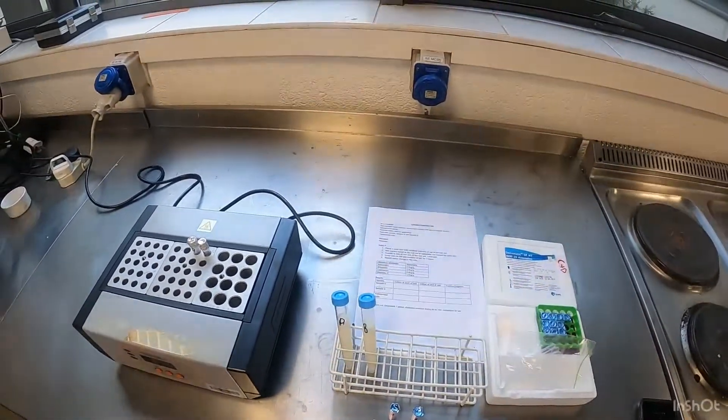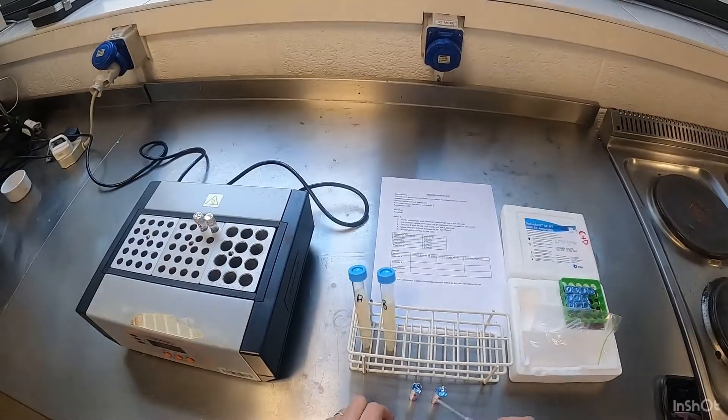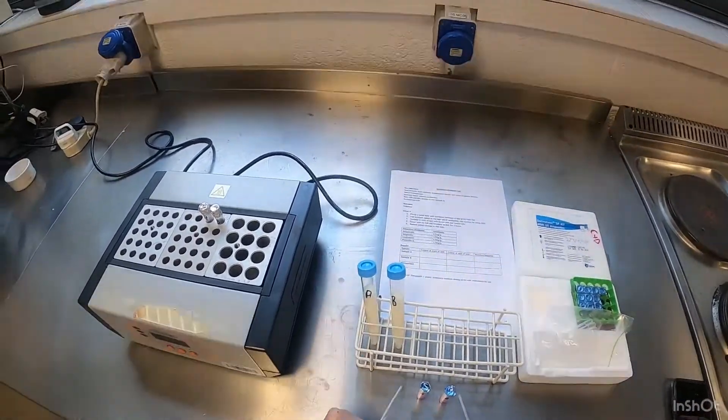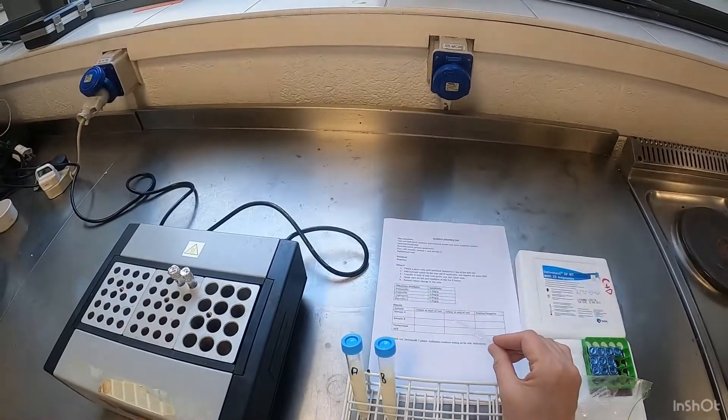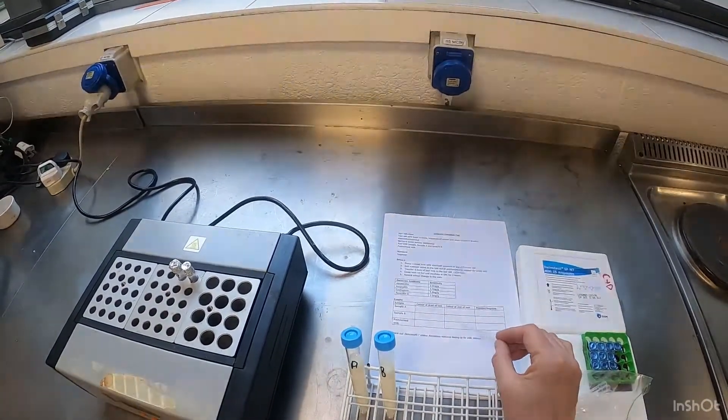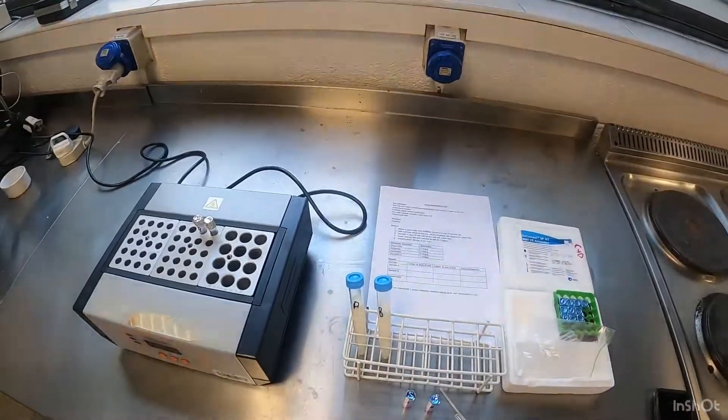The sensitivity of the test for the particular antibiotics is listed in your practical manual which is available on Blackboard.